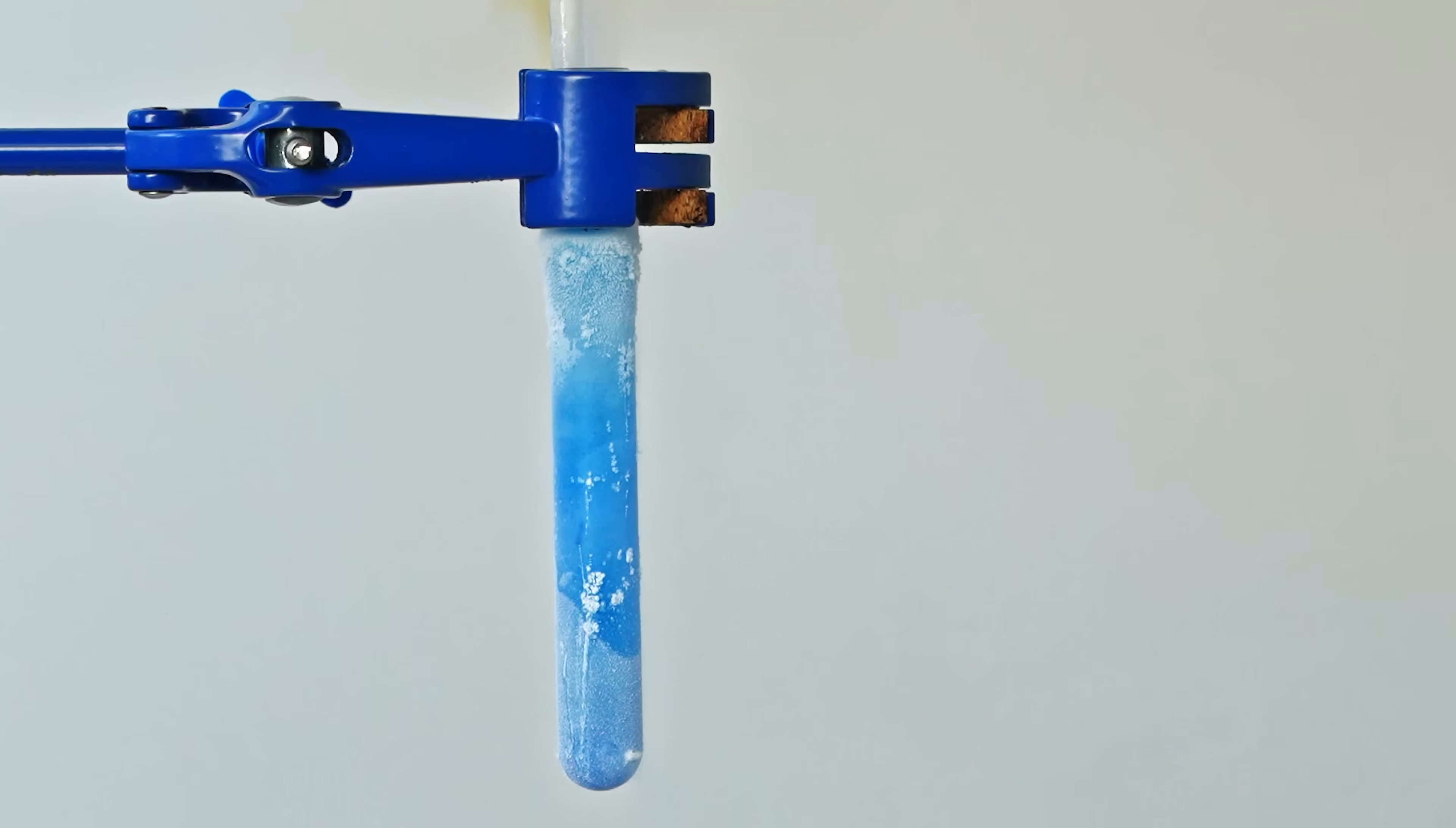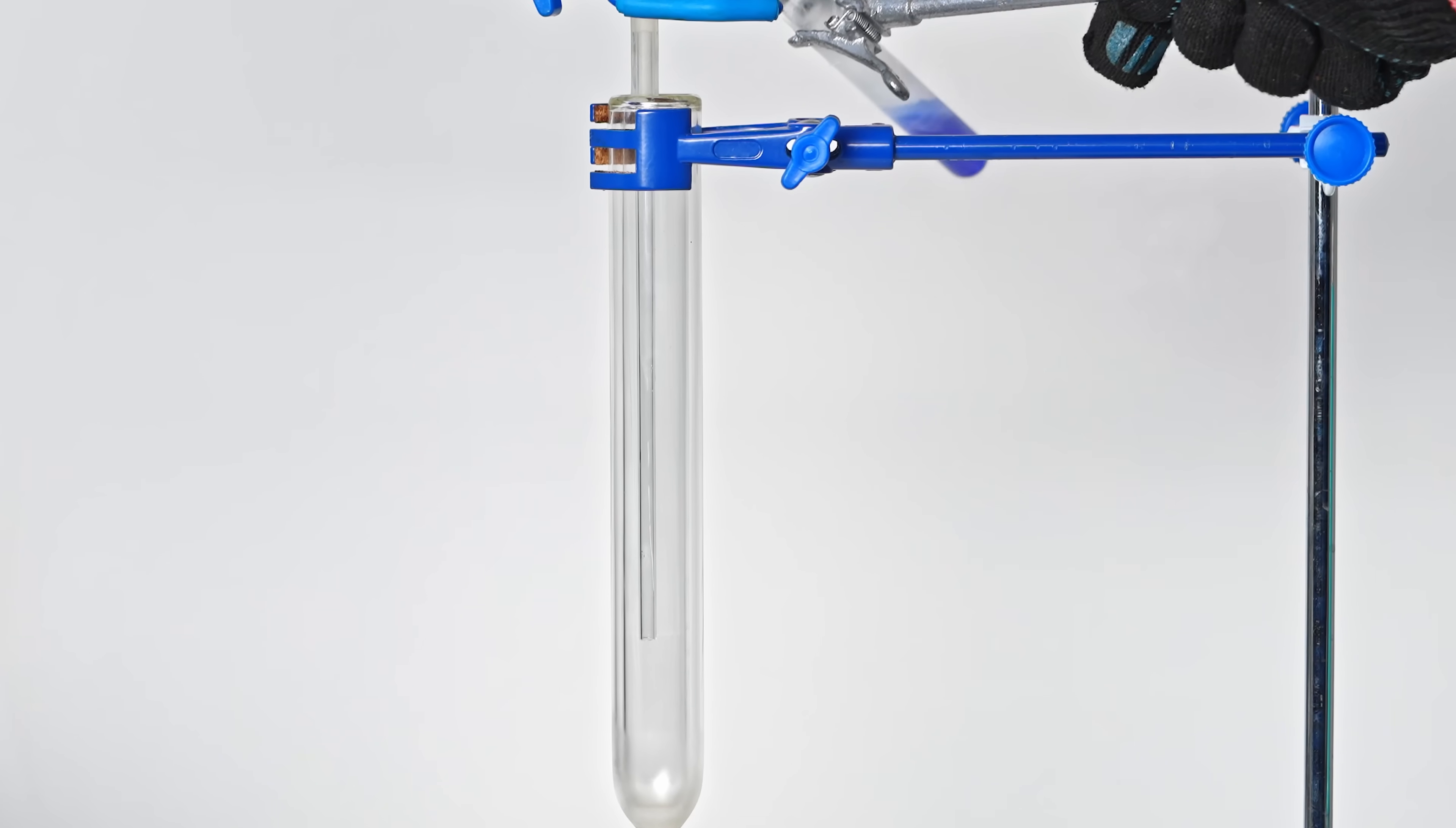Did you notice something else during this reaction? When replaying, you can see a small flash lasting a single frame. This confirms I'm on the right way. The issue is the low ozone concentration.